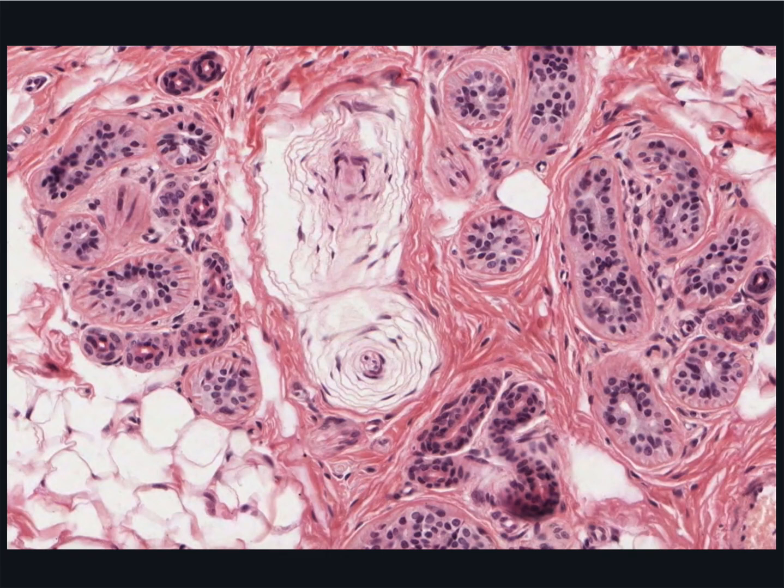You're now looking at the bottom of the dermis at a cluster of sweat glands. This is adipose tissue here. These coiled, simple glands have a duct portion and a secretory portion. The duct extends fairly straight from the epidermis down to the border with the hypodermis.